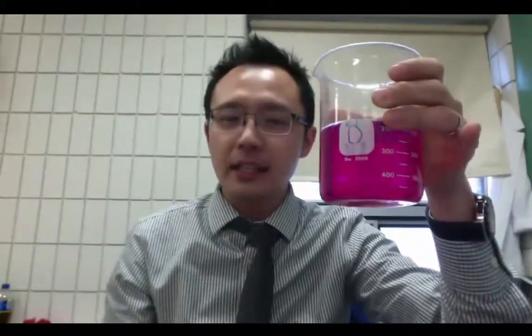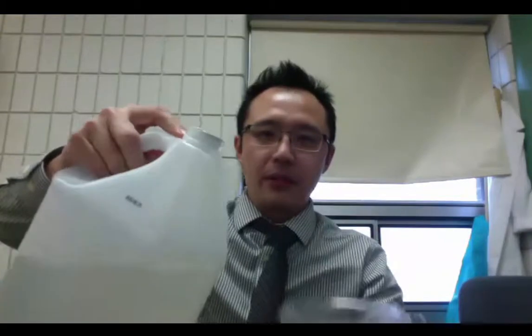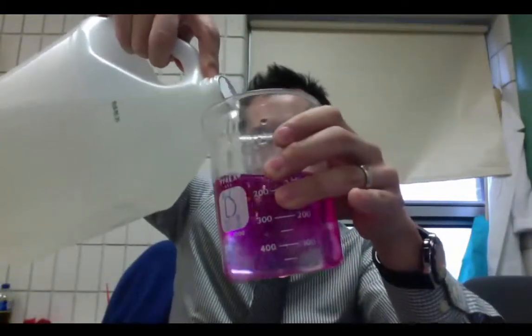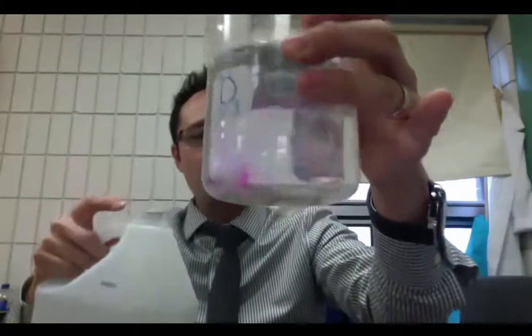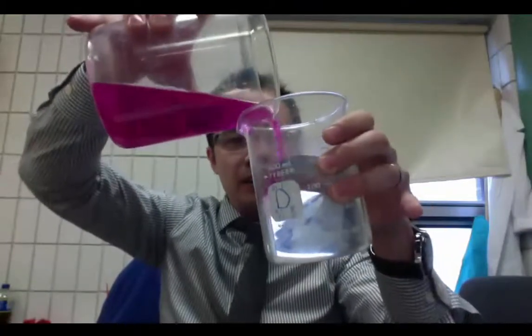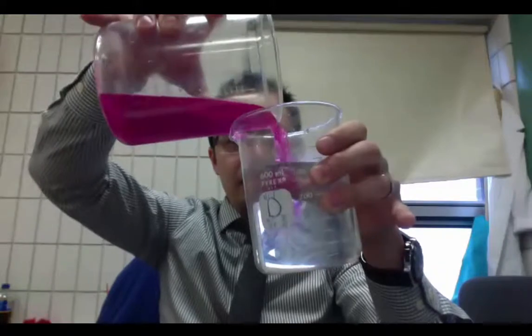I can drop and lower this pH because pH scale is like a seesaw. And I can lower that by adding more acid. So I'm going to add more vinegar. I'm just going to add vinegar. And you can see that I'm going to start adding and it changes into colorless. So I can do this back and forth depending if I have enough.